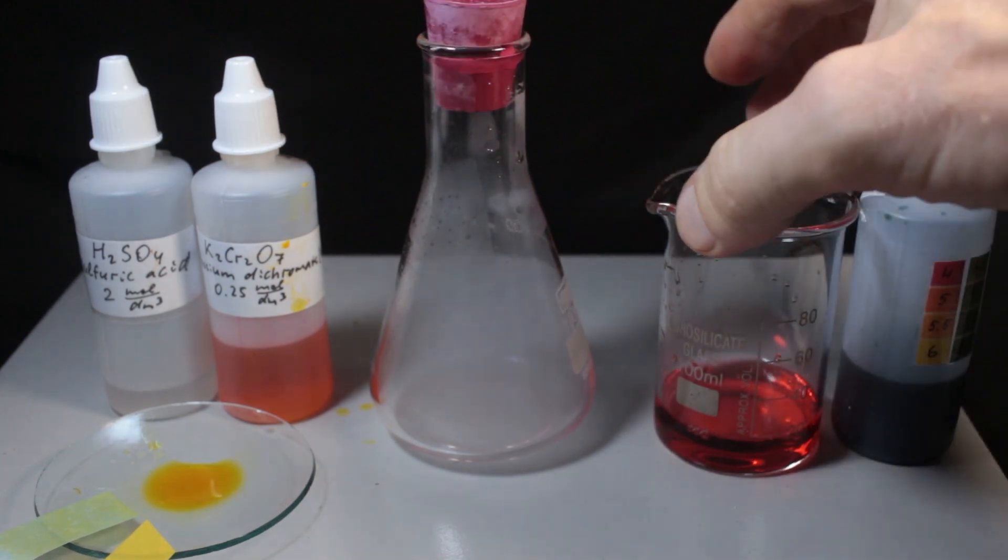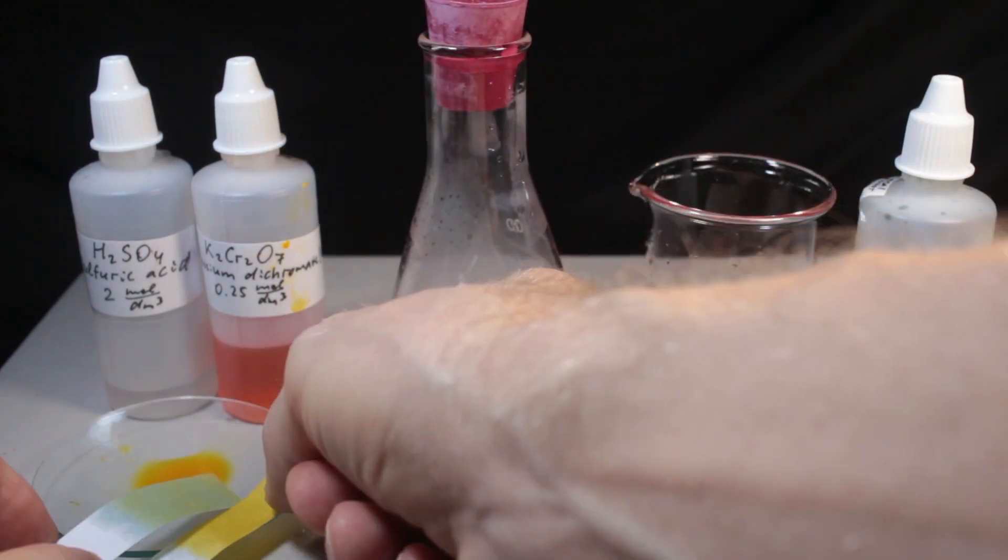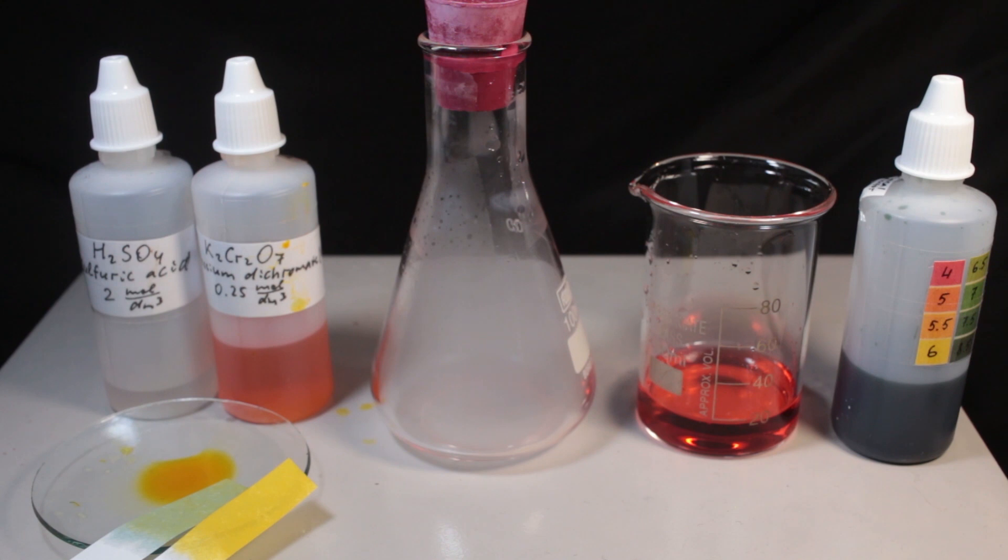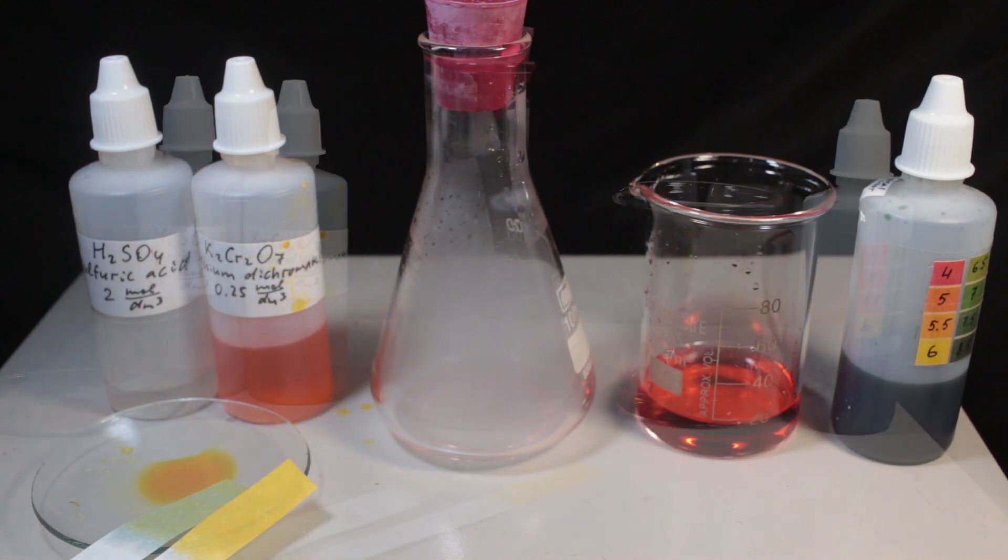Okay, here is the group photo of the result. Acidic properties and reducing properties of sulfur dioxide.